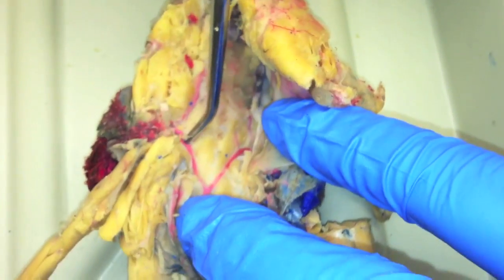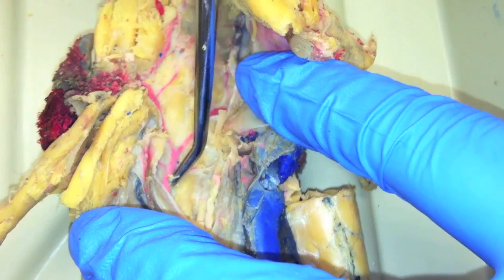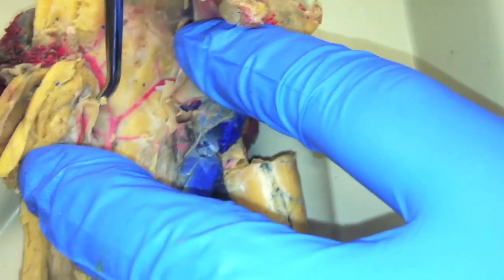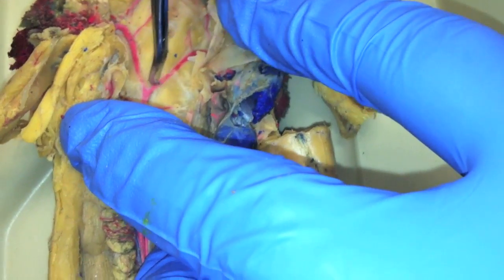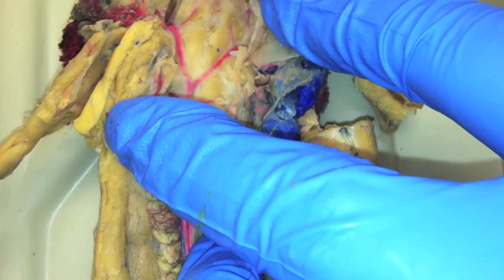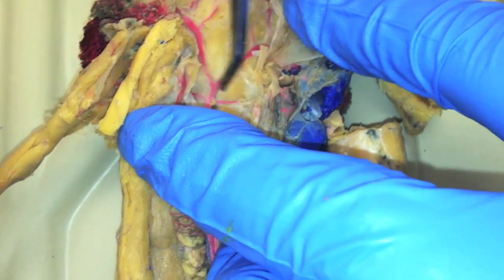We got the mud puppy. The dorsal aorta comes up and it branches — the radices of the dorsal aorta — and when you go down one, subclavian artery to the right.